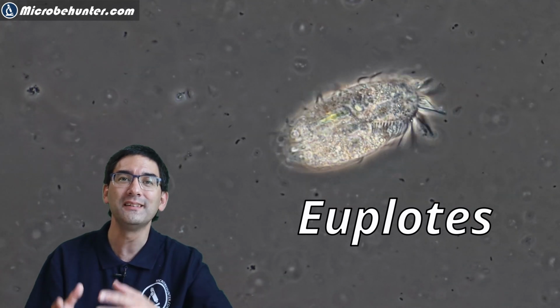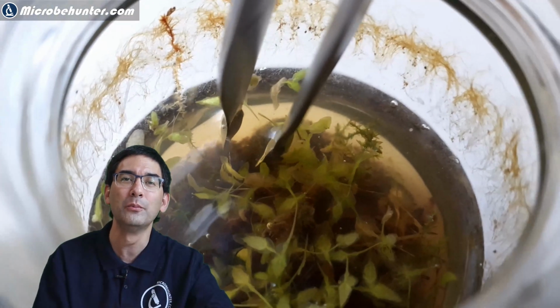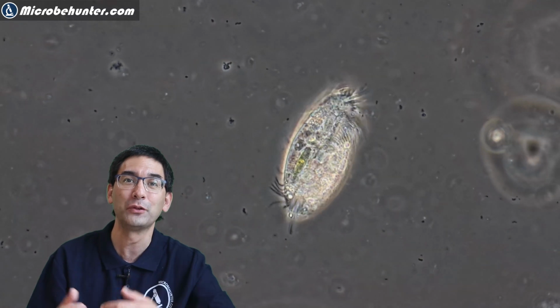Euplotes is a single-celled microorganism. It is a ciliate, and on the surface of Euplotes you have those tiny little hairs that are moving. These are called the cilia. I isolated it from a fairly old water sample that I had standing on my windowsill for several days.